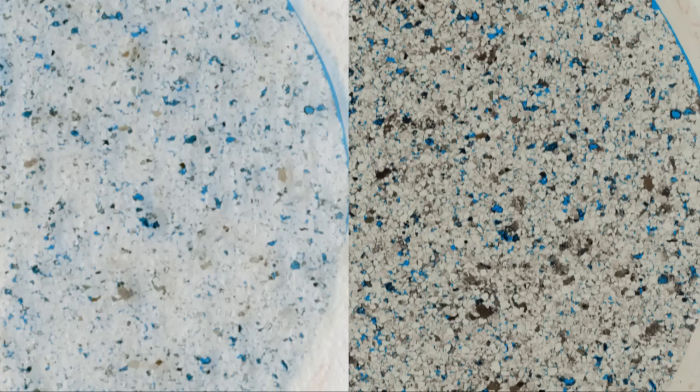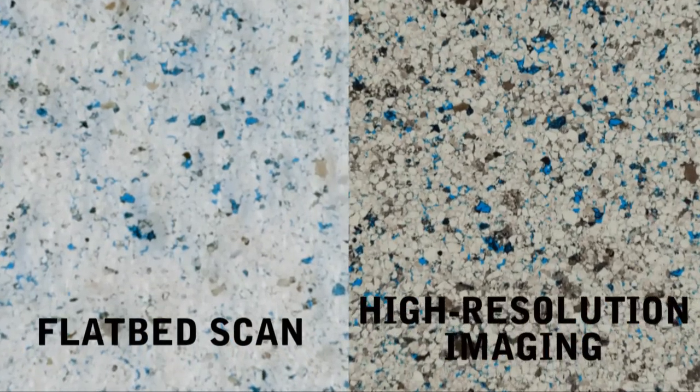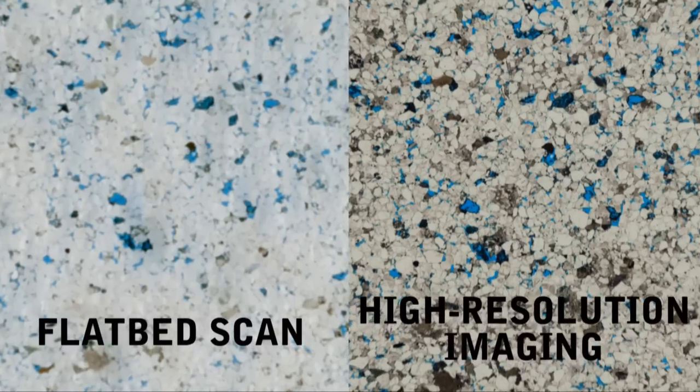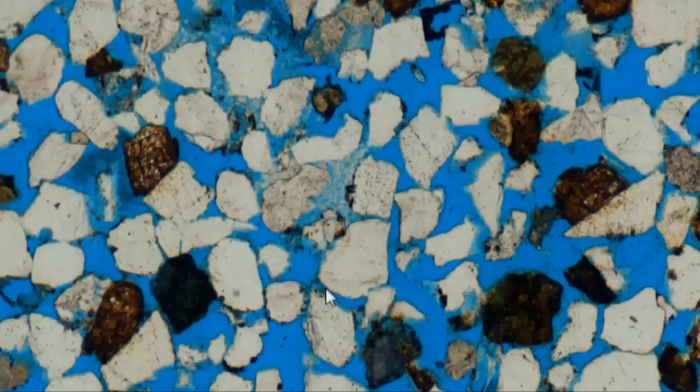Here's a couple of examples. On the left is a traditional flatbed scan, and there are high-resolution tiled images on the right. Note the pixelation of the flatbed scan at even low zoom levels.